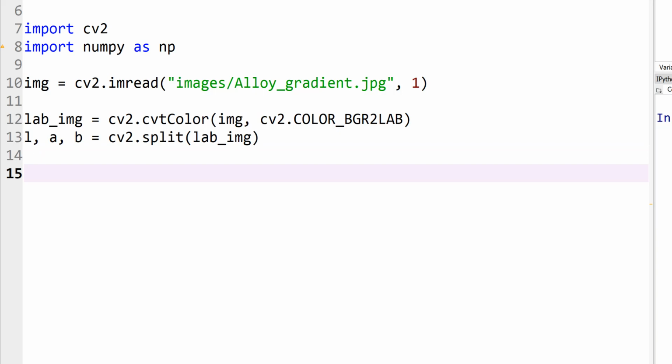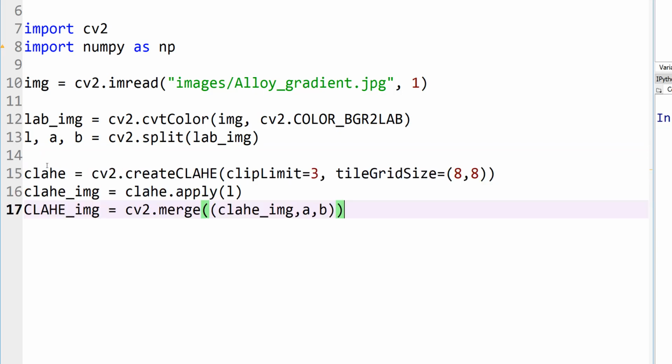So now I'm going to apply my CLAHE to this L channel, and how do we do that? First, we need to create a CLAHE instance, which is what I've done here, and then I'm going to apply that onto my L channel, okay? And this is all available as part of OpenCV, and again, I explained what the clip limit and tile grid sizes are in my previous tutorial. And finally, once that luminance has been adjusted, I'm merging the other color channels to recreate my original colored image. So let's go ahead and visualize my corrected image.